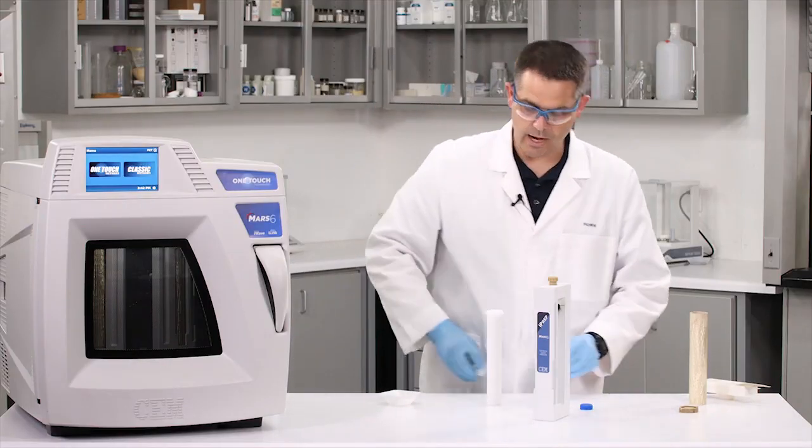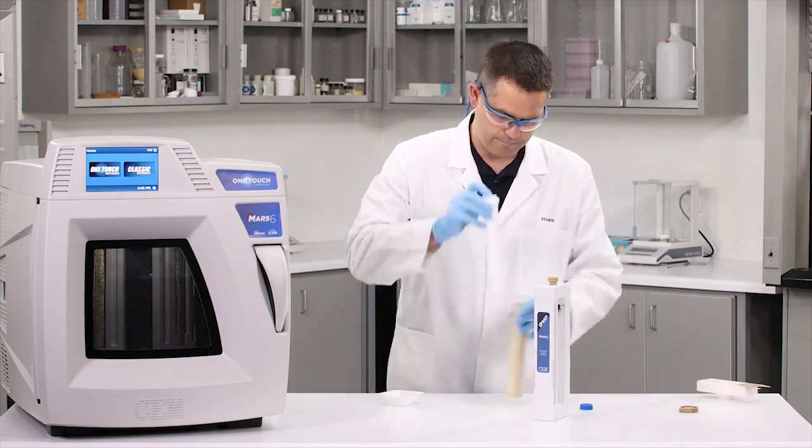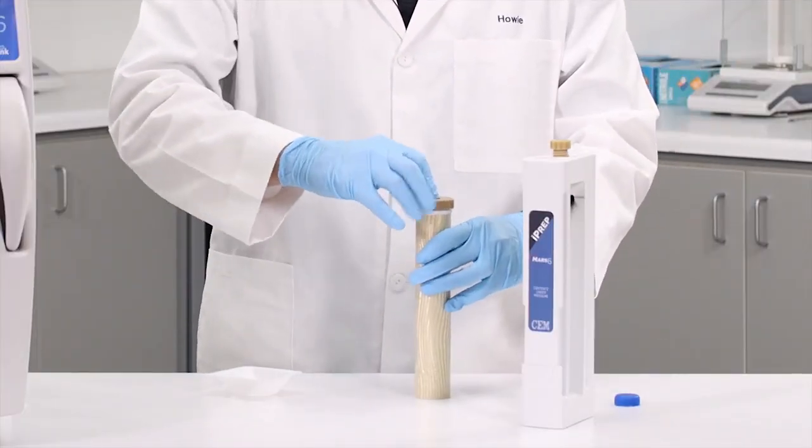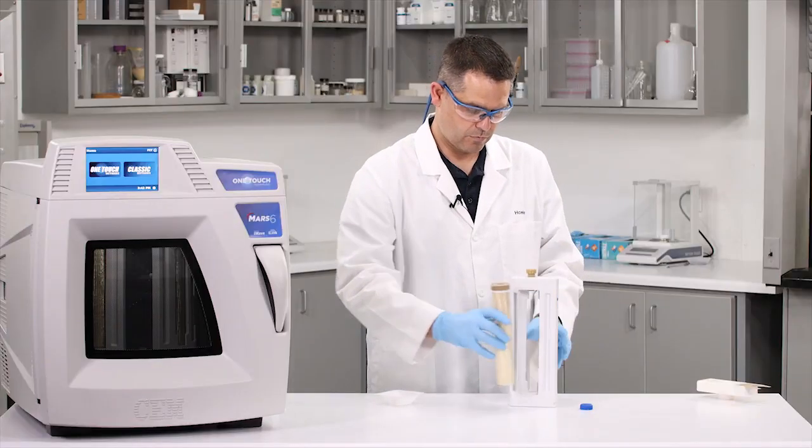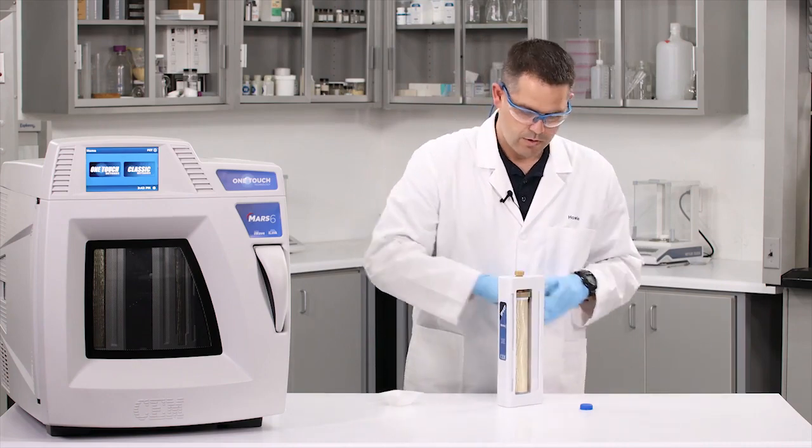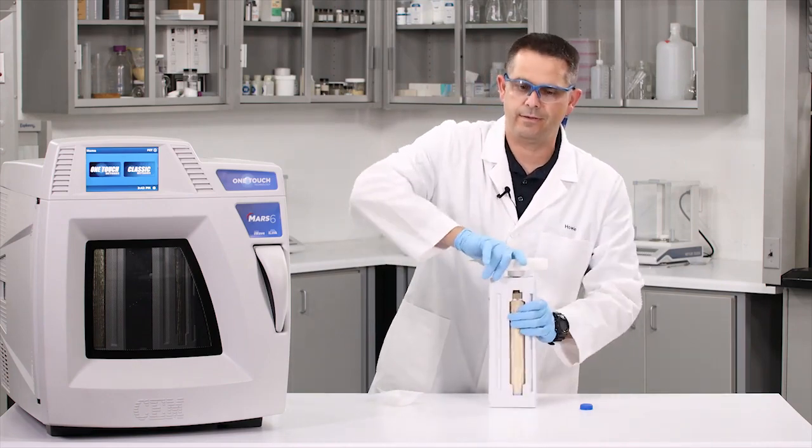All right, now we're going to cap this up and torque it. This sample is ready to go into the microwave.